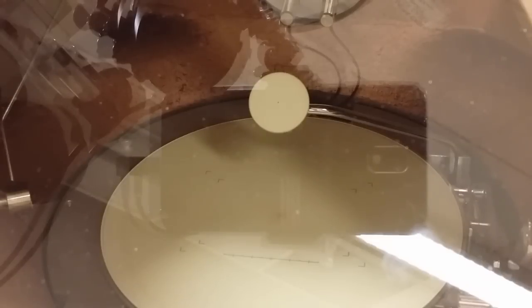So this is the viewing screen in the microscope. You can also see that there are two screens. One smaller dish atop of the bigger one. The smaller dish is used for the binocular view and the camera view in this setup. For the current demonstration we turn off the small dish. So now we only have the big dish that is exposed to the electron. I shall turn off the light in the room. The green regions you see is the fluorescent behavior of the fluorescent screen when it is hit by electrons. You see the green squares. And if I translate the sample you see that these are repeats. So the black bars in the picture are the copper mesh of the TEM grid. So the actual sample that we are going to look at is the small tiny black dots that you see inside these squares.